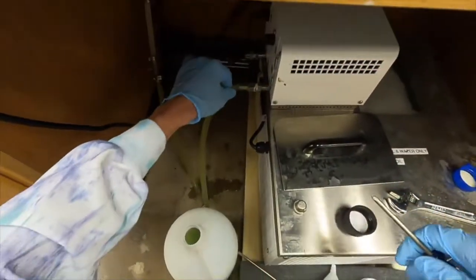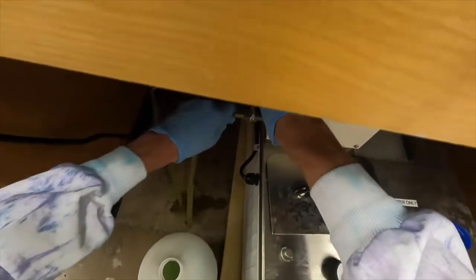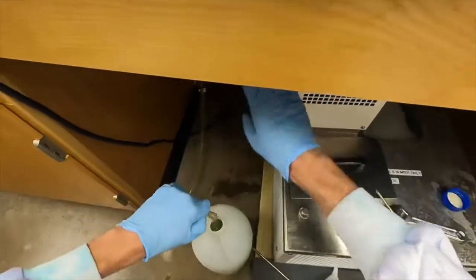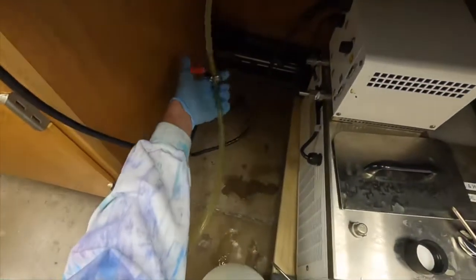I kind of just kink the hose with my fingers like this, then you can just pull the hose off and then put this into your bucket that we started with.